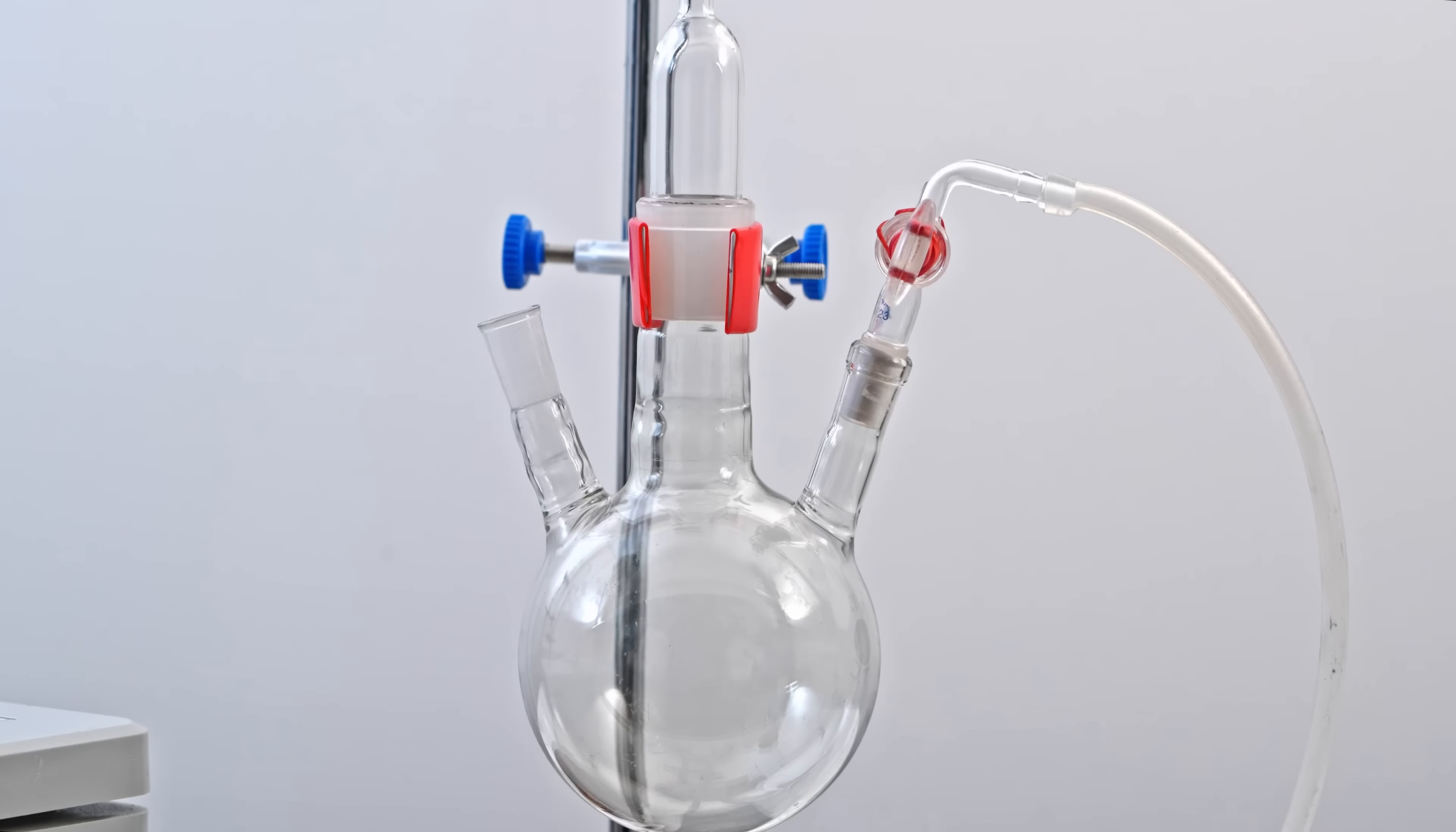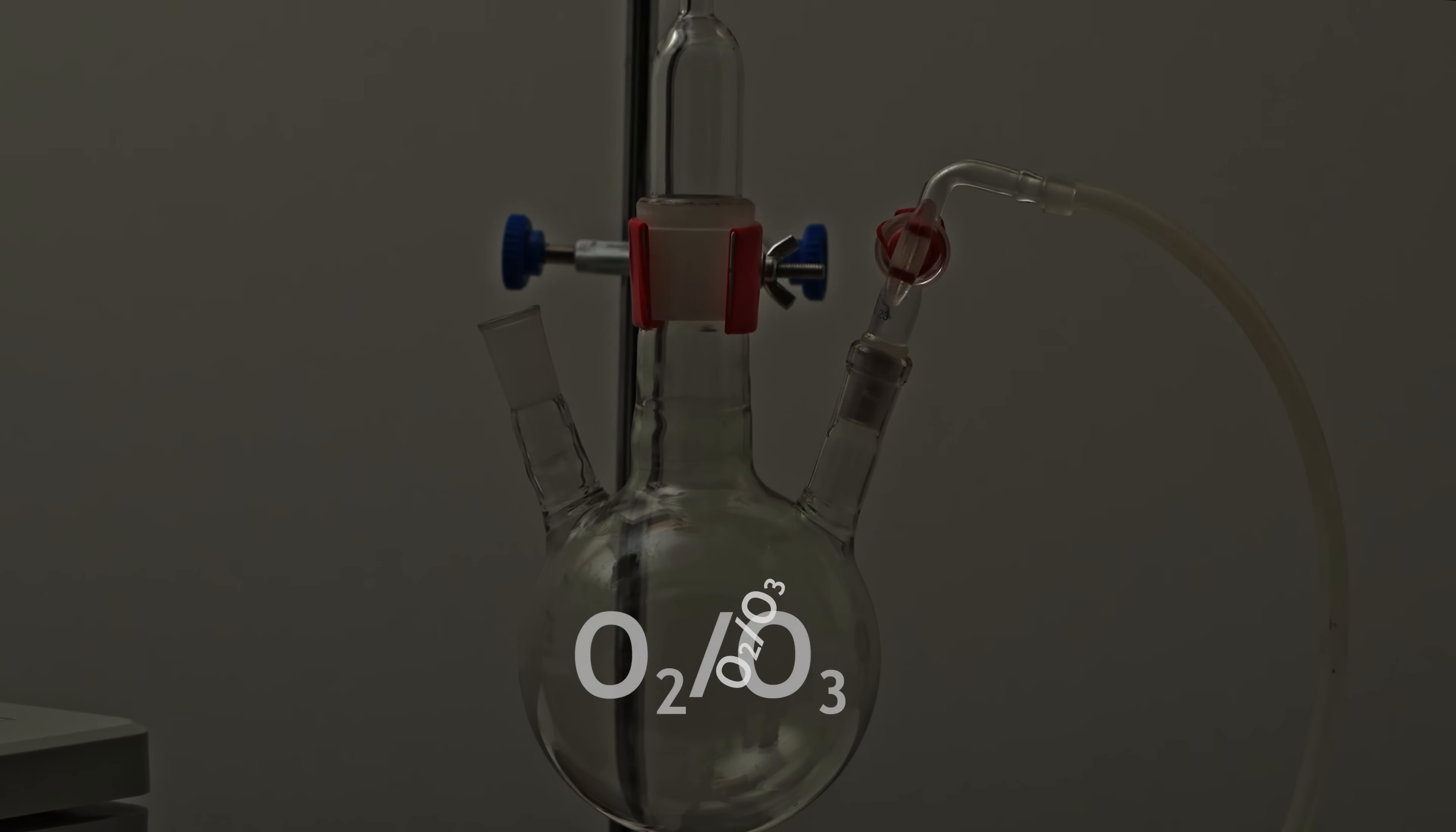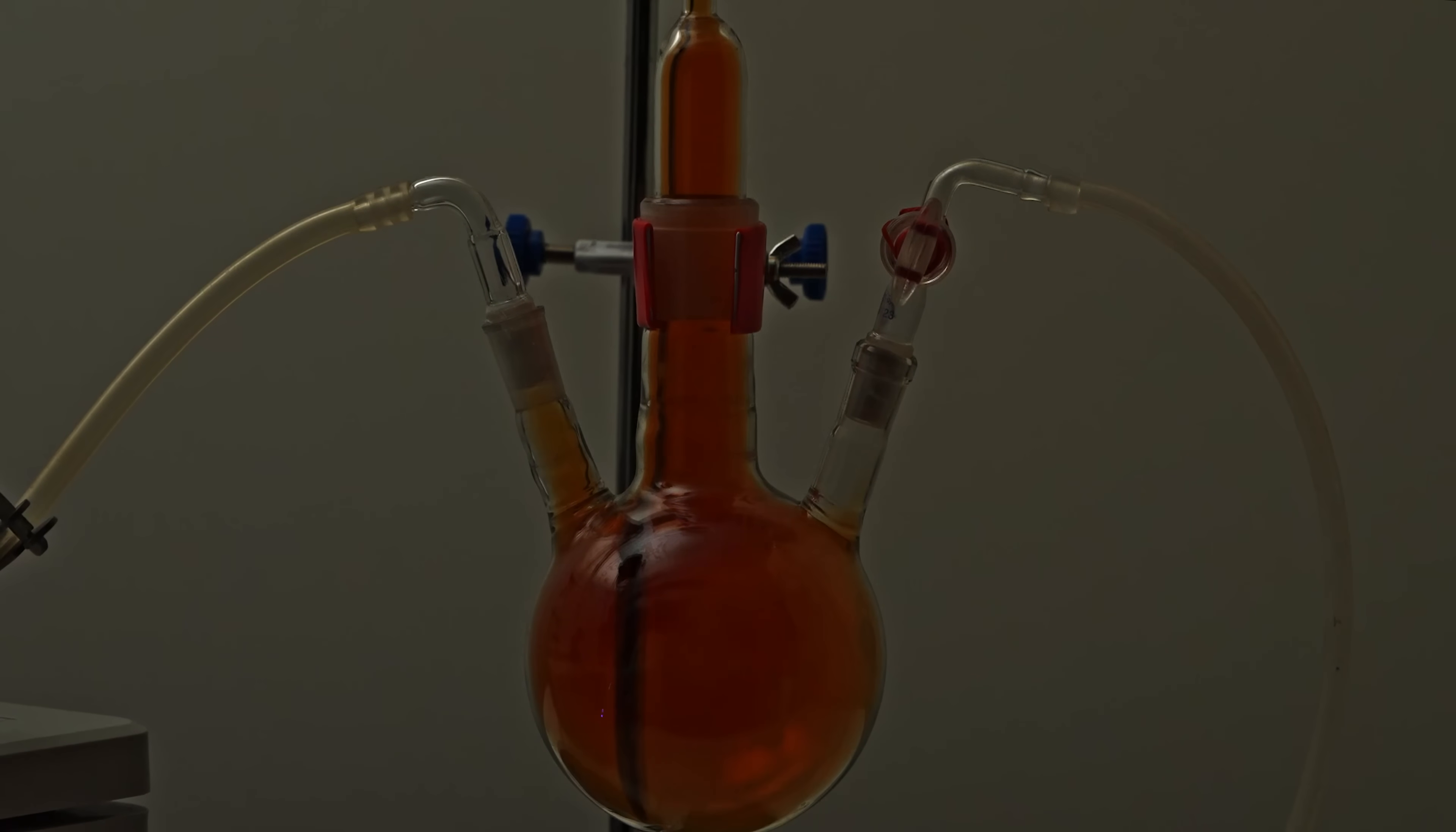For my first attempt, I used a three-necked flask filled with ozonated oxygen and introduced nitrogen monoxide into it. However, I didn't observe any chemiluminescence. I repeated the experiment several times, both in complete darkness and with different methods of introducing nitrogen monoxide, but the result was always the same.